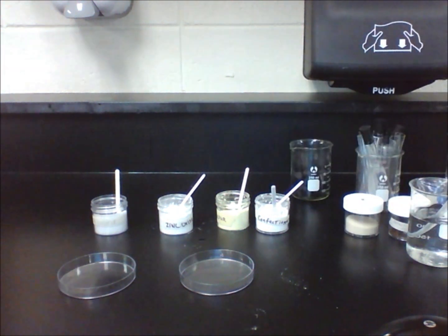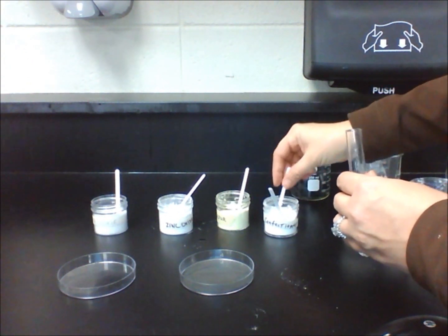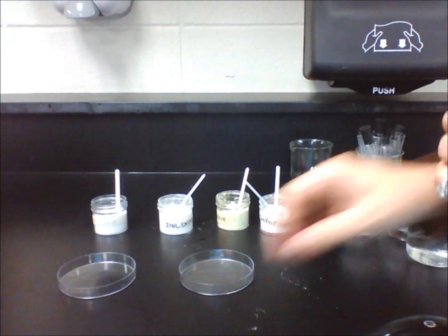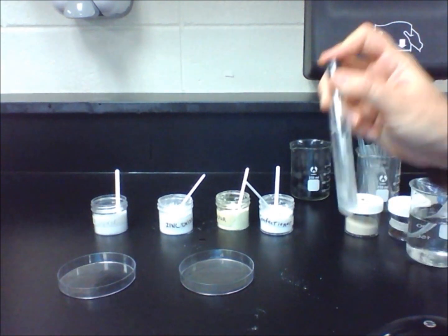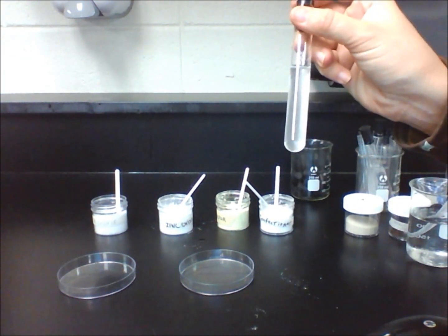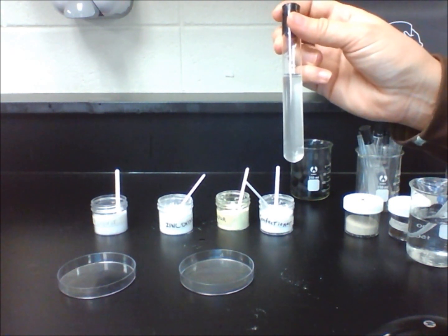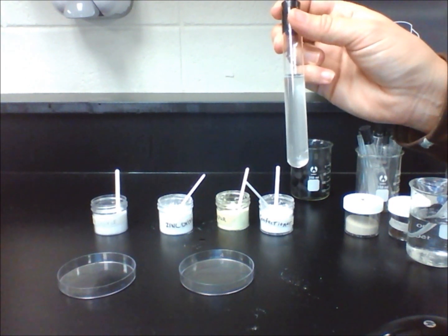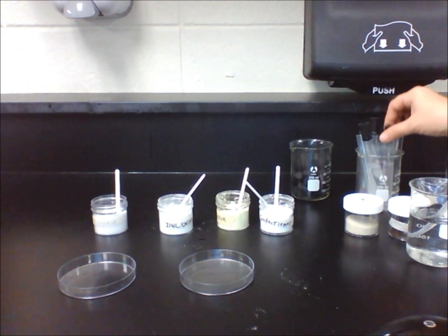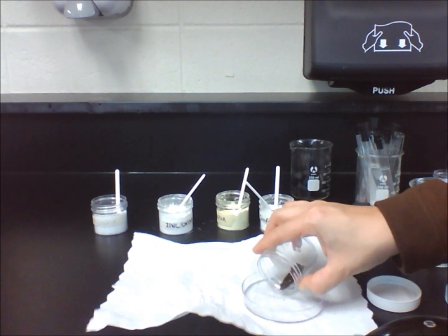The last substance is confectioner's sugar. After shaking the mixture ten times, you will see that the clear water has turned into a hazy white color and none of the solid powder is left in the test tube. Therefore, this substance did dissolve in water. When a substance dissolves in a solvent, they are said to be soluble. And when a substance does not dissolve, they are said to be insoluble. The solutions that we made consist of the liquid solvent — or water in this case — and the solute, the dissolved solid.